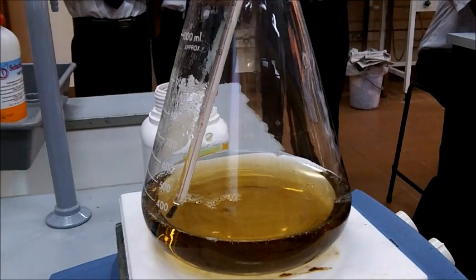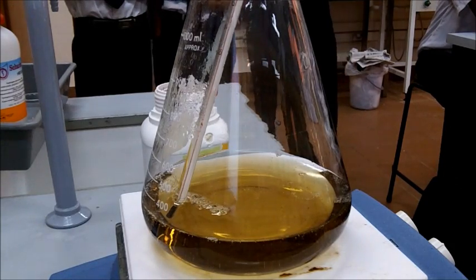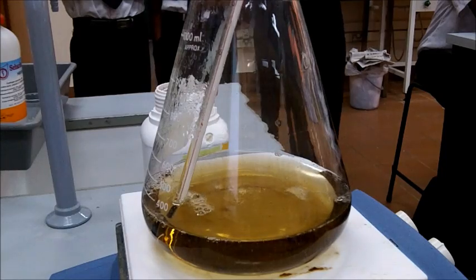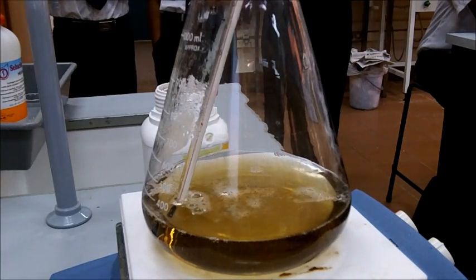Maybe goldy color, sometimes. Forming bubbles. More bubbles forming all the time. It's getting faster. It's accelerating.